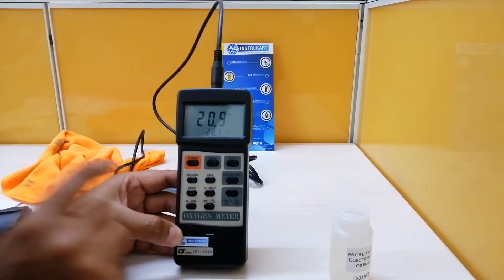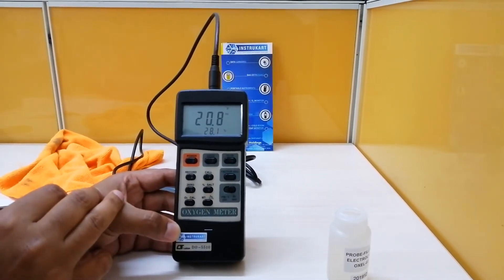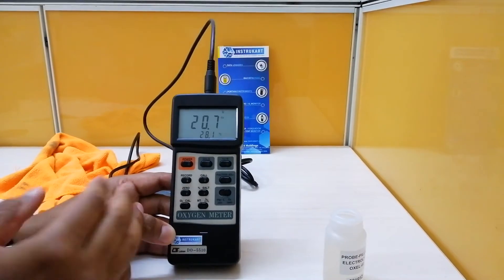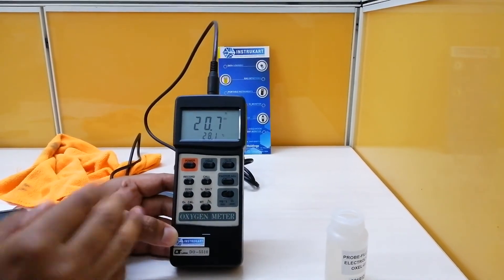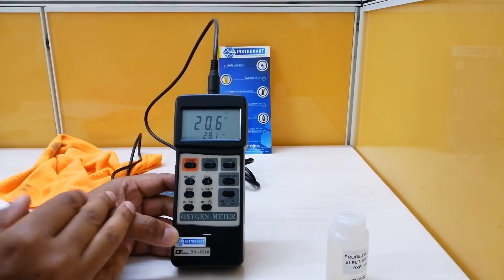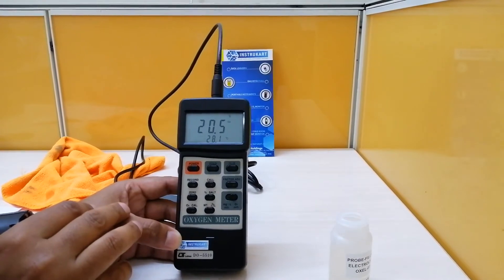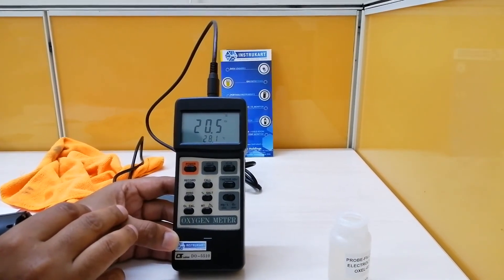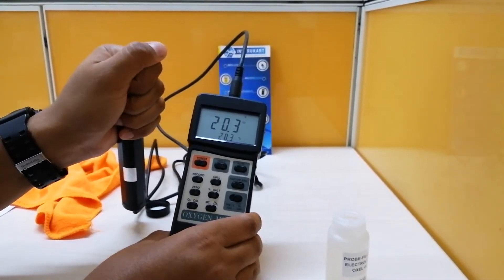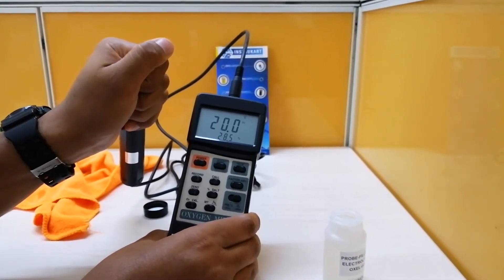We can now press the cal button. This shows the current oxygen level. As you know, the atmosphere contains around 21% oxygen, 78% nitrogen, and 1% argon and other gases. So it will come up to approximately 21%, plus or minus, depending on the atmosphere. You can see I am using the same probe to capture the oxygen level in air.